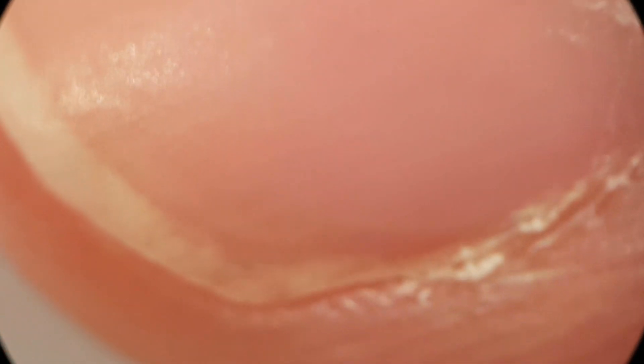Another request was to look at my hands and skin under the microscope. Here you can see the nail of my middle finger — by the way, I didn't intend to give you the finger. Let's switch to my index finger. As you can see, it's just not pretty — everything is more gross when magnified. Here's the skin of my finger, and let's switch to the back of my hand.